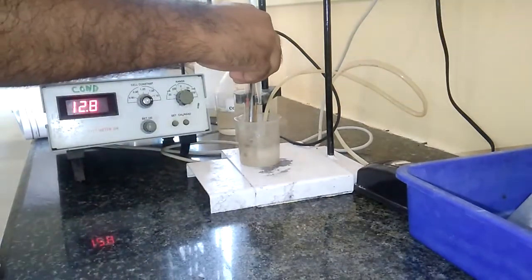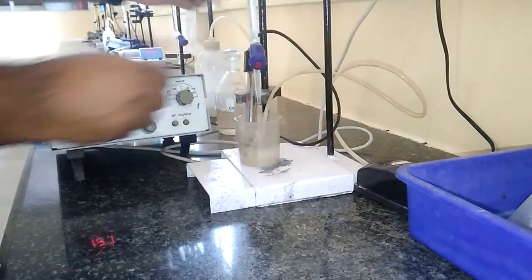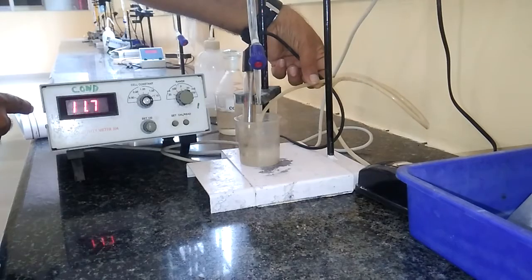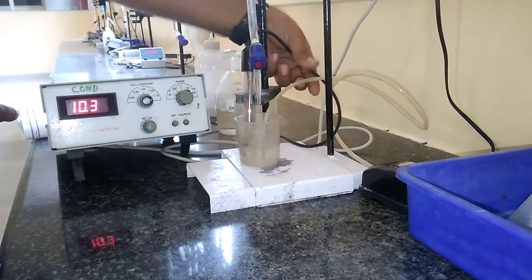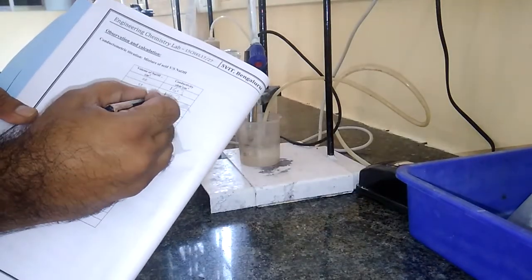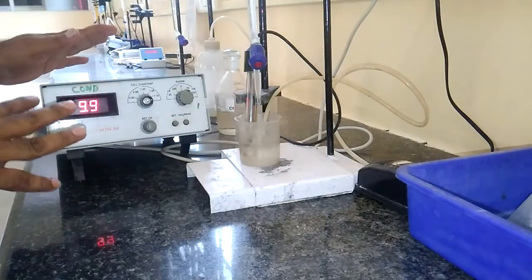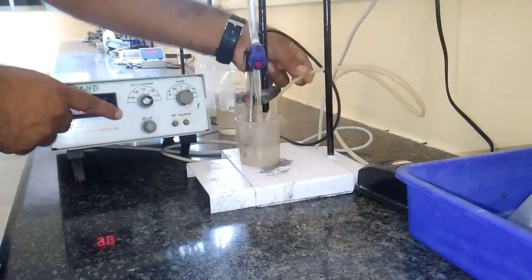Further, let us continue by adding another 0.5 ml of NaOH. Again it decreases — for 1 ml it is 10.3. Like this, there will be a continuous decrease in the conductance values until the complete neutralization of the strong acid.